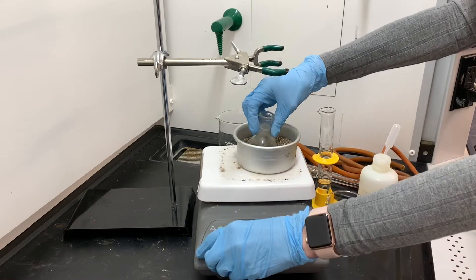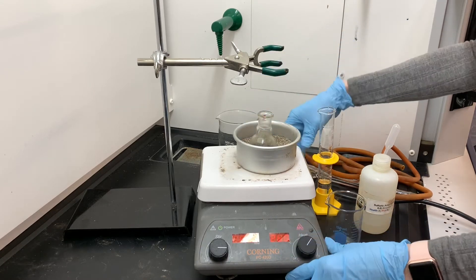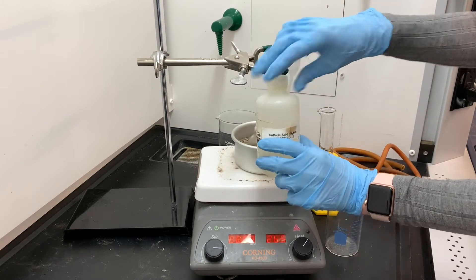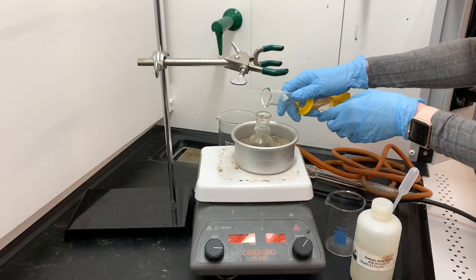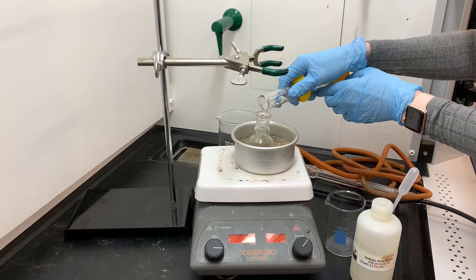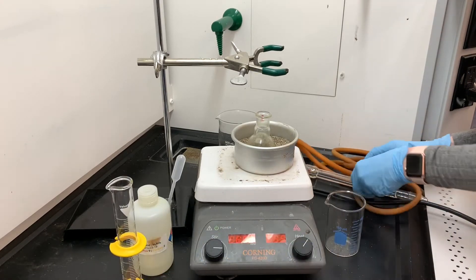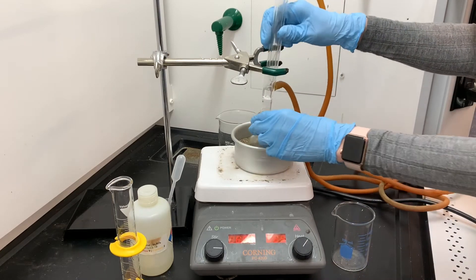I'm going to add a stir bar and then nestle this down into the sand bath. It's important that the level of sand is at least as high as the liquid inside the round-bottom flask to make sure that everything is being heated evenly. Now I'm going to add sulfuric acid — it's 6 molar, and I've got 15 milliliters of it already measured out — straight into the round-bottom flask. This reaction involves a ketone, the carvone molecule, reacting with an acid, the sulfuric acid.